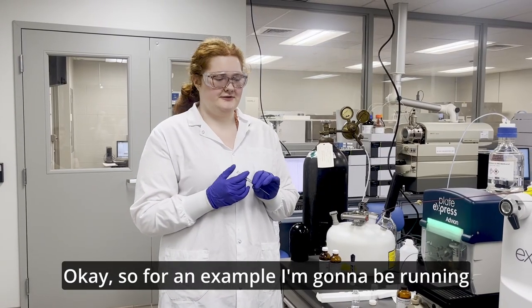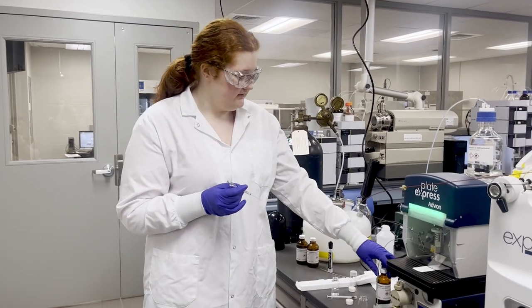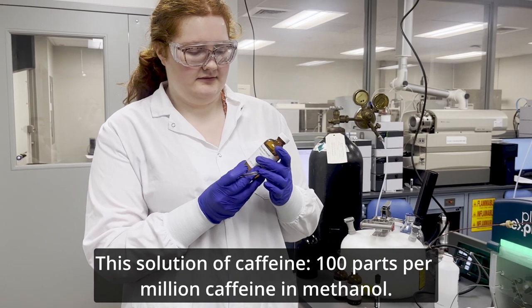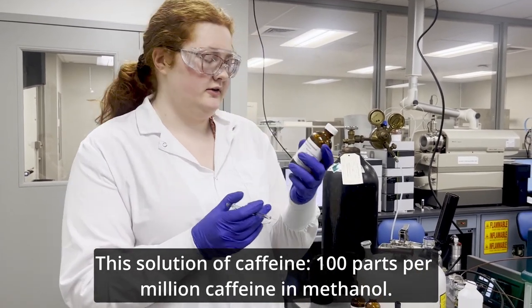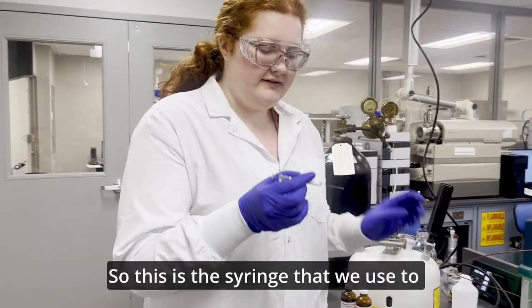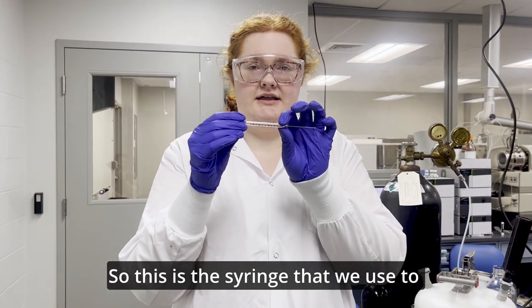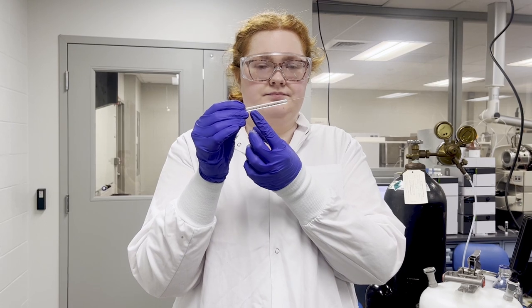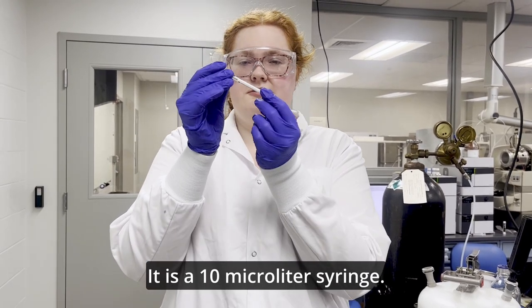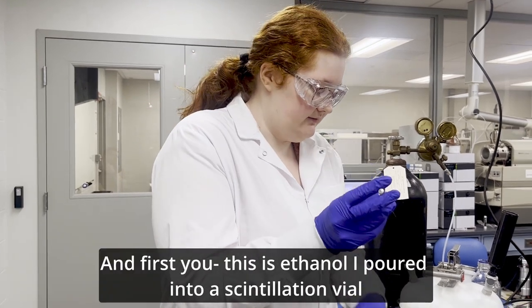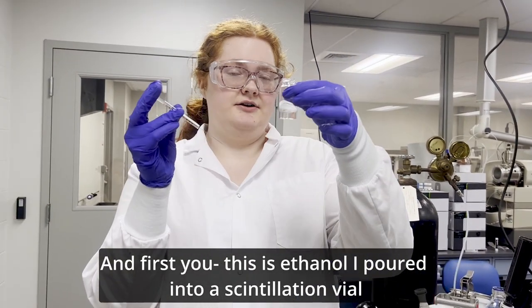Okay. So for an example, I'm going to be running this solution of caffeine, 100 parts per million in methanol. So this is the syringe that we use to load the sample. It is a 10 microliter syringe. And first, this is ethanol.